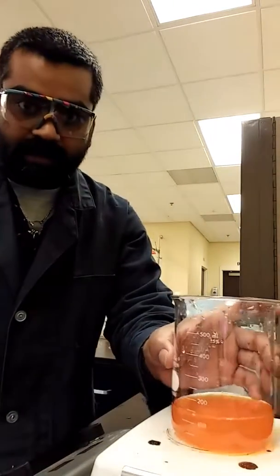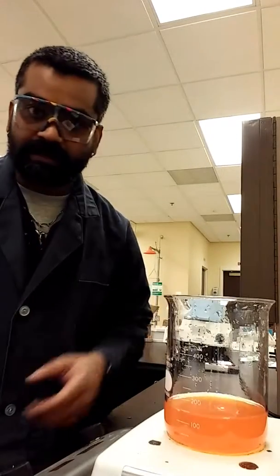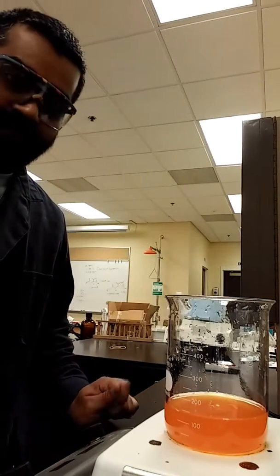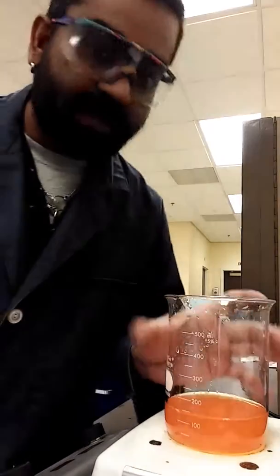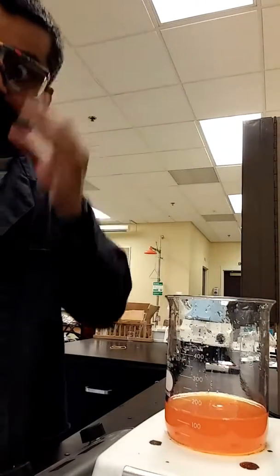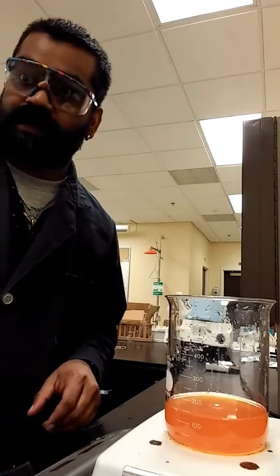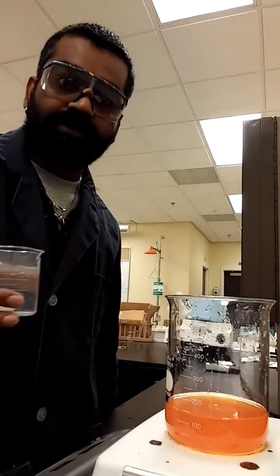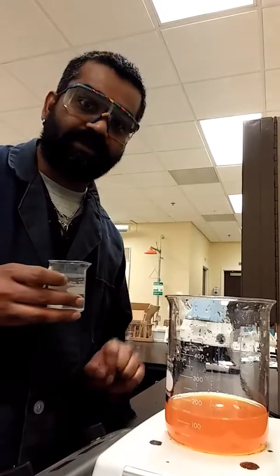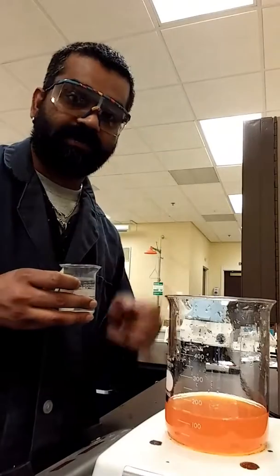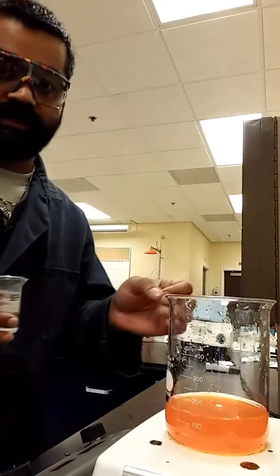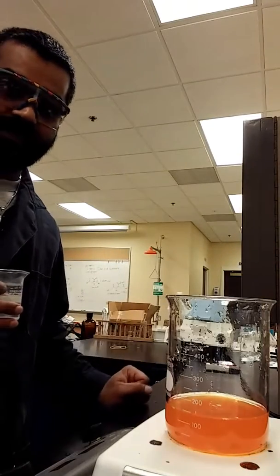Okay, I'm back now. I got all of the liquids filtered. It took a little bit of time, but it was worth it. I have a clean liquid here in the jar. And so this is the second step in the process. And what we're now going to do is we made sodium citrate in the previous step, which is the first step where we added sodium hydroxide to citric acid, which is acidic, into a basic solution.